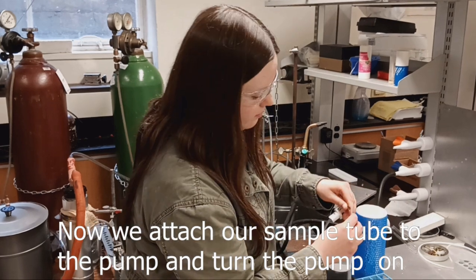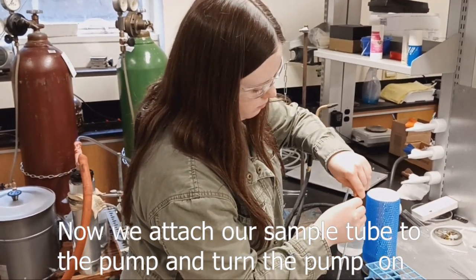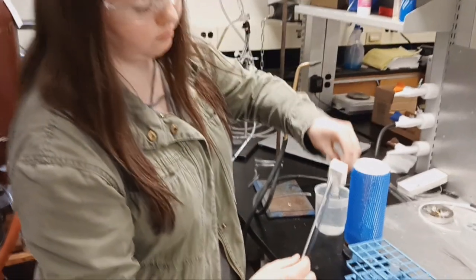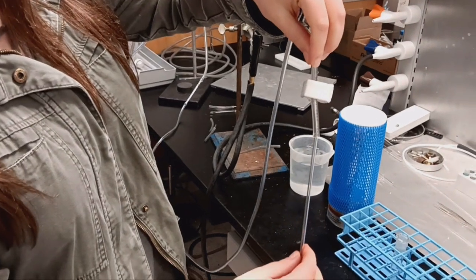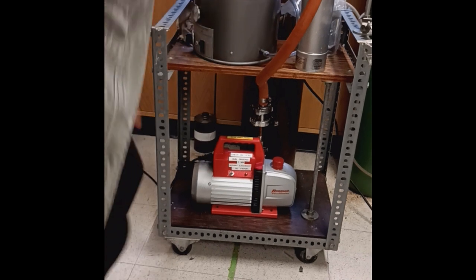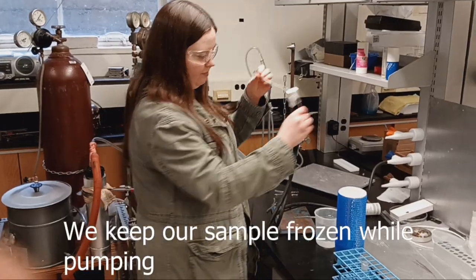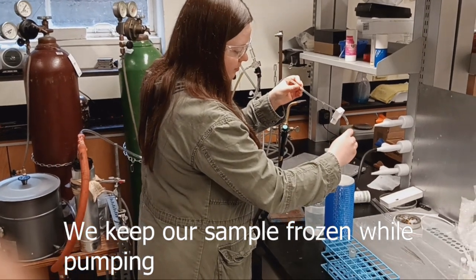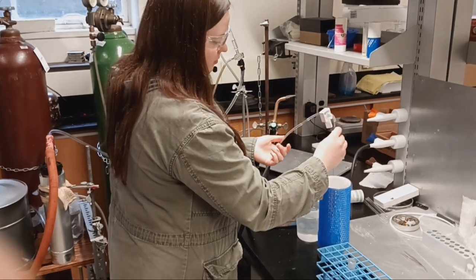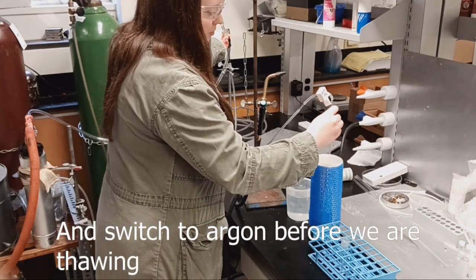Now we attach our sample tube to the pump and turn the pump on. We keep our sample frozen while pumping, and switch to argon before thawing.